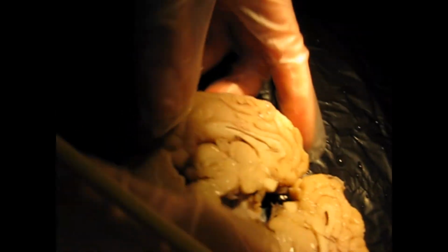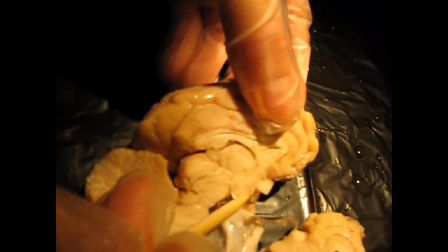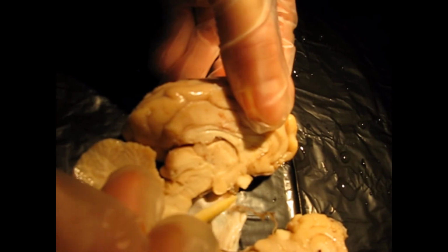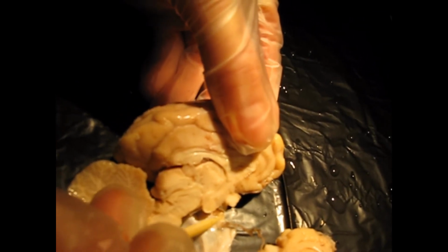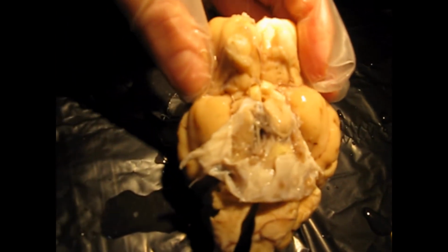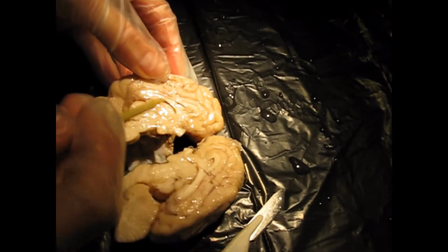Okay, and let's see if we can get. Yeah, so the hypothalamus is right here, and then we have a nice little passageway for communication and for secretion of hormones called the infundibulum that travels to this pituitary gland, which you can see again is right here. And remember that sits in the sella turcica. All right, so we have the diencephalon.